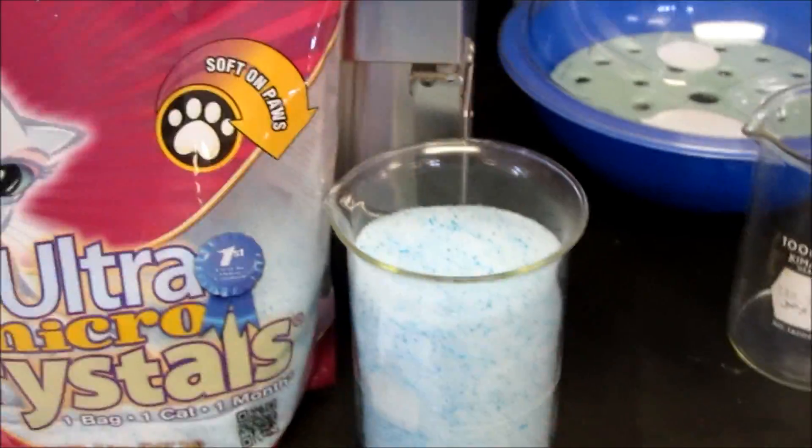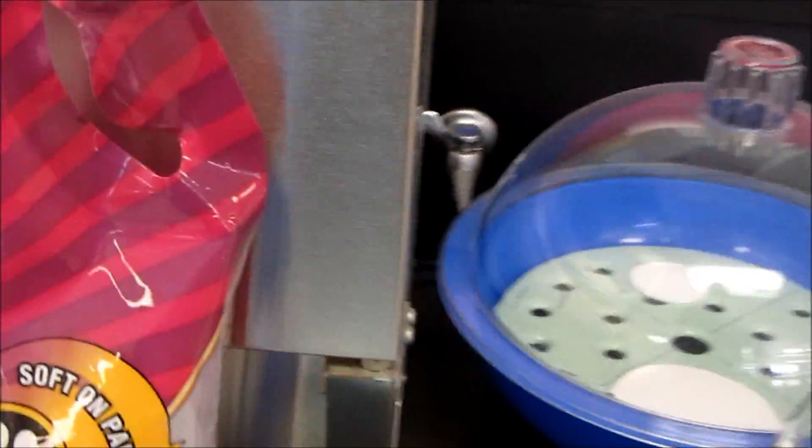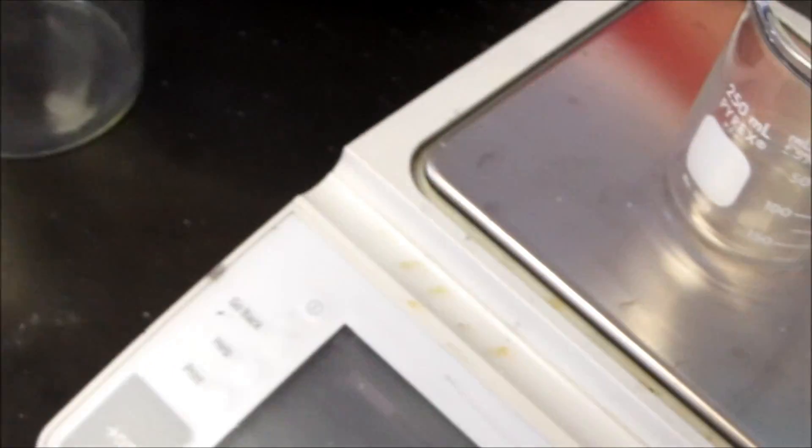There's a thousand milliliter beaker full right there. I'm going to pour out about 500 grams, 516 to be precise.